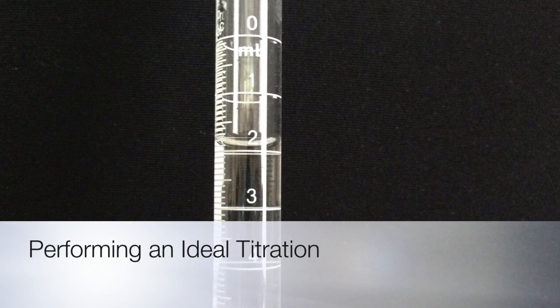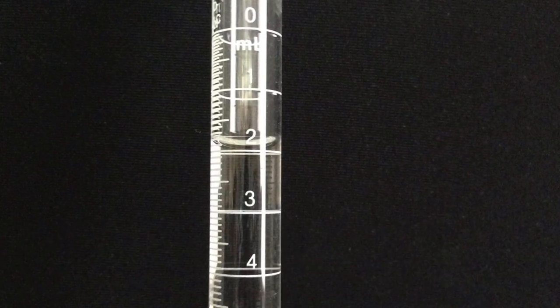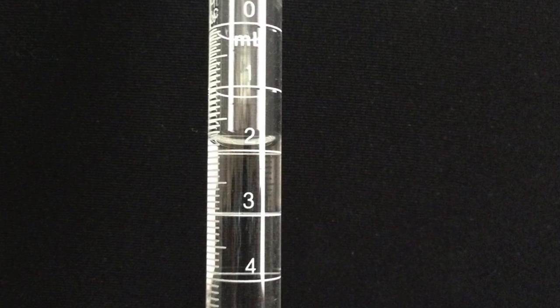Today we will be focusing on how to run an ideal titration. First, take the initial burette reading by reading from the bottom of the meniscus.